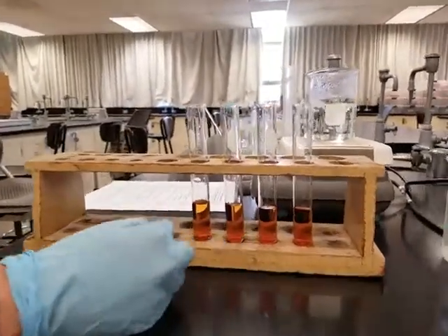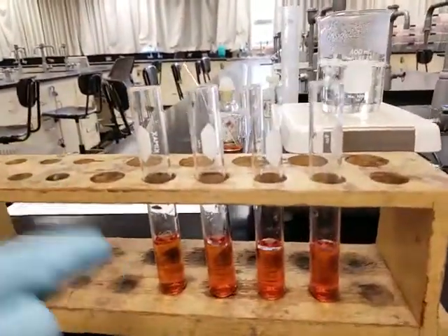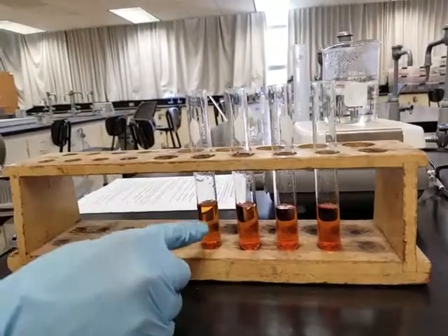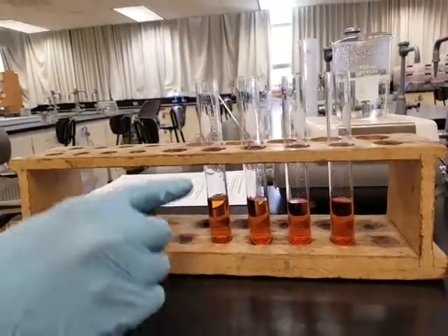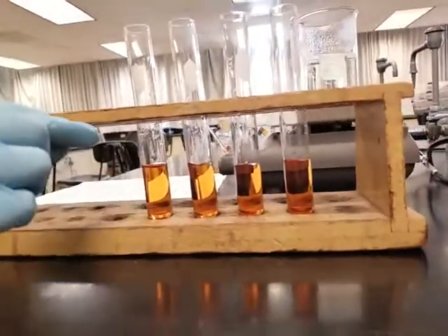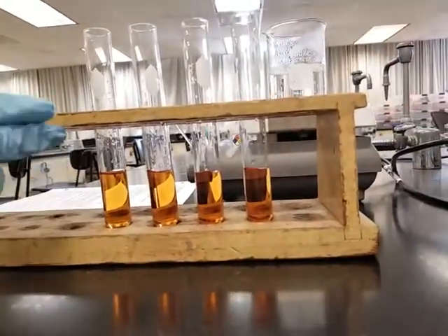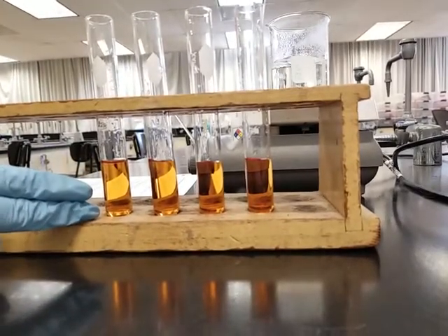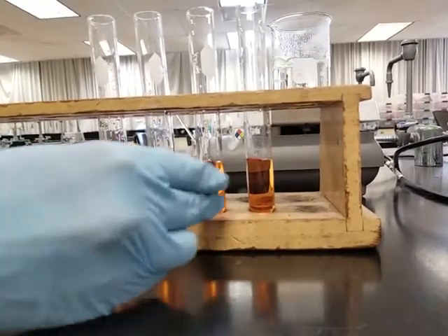Anyway, these are the 4 test tubes that we will be dealing with in part B, with the equation that's already listed. The first test tube is going to be your control. A control is a test tube where you already know the color, nothing's going to change, and you predict that it's going to stay this way forever. Then we're going to do different things to the next 3 test tubes.